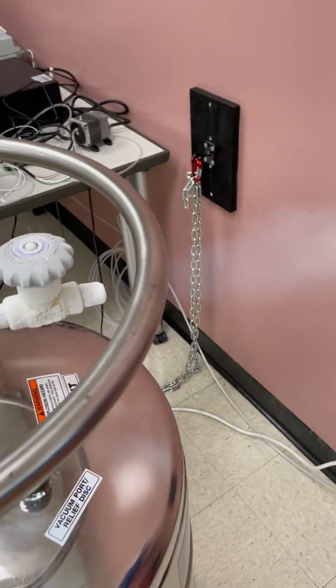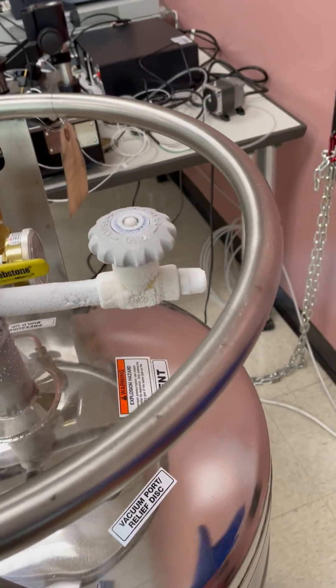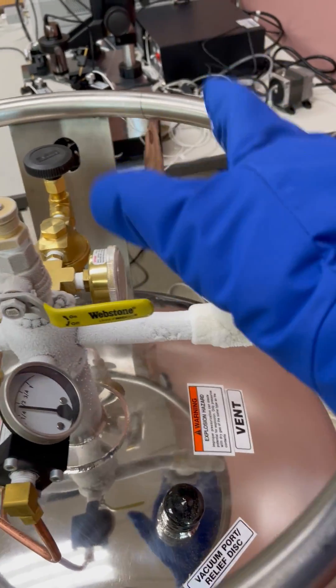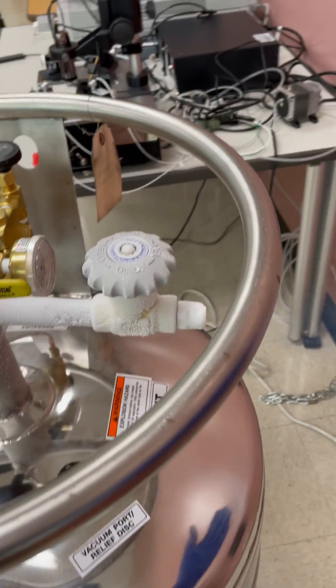The most important is fully open the vent, so the pressure can come out. So be careful, don't get hit by this cold gas, right? When it is full, you will see liquid nitrogen coming out.